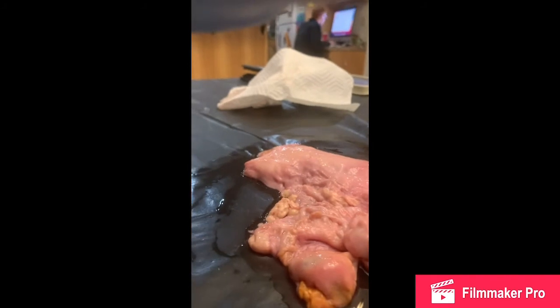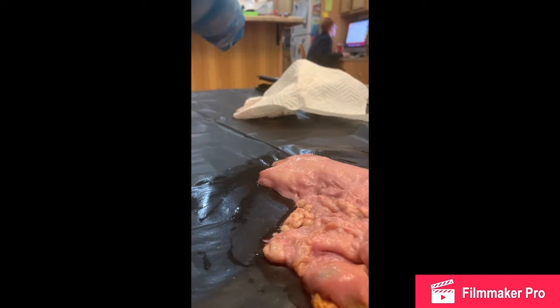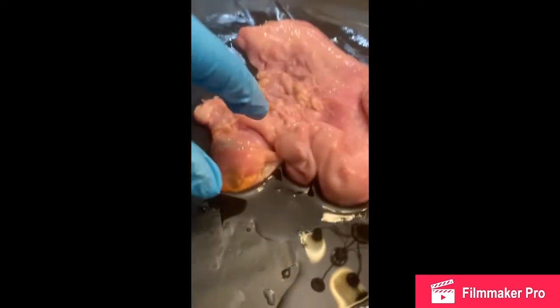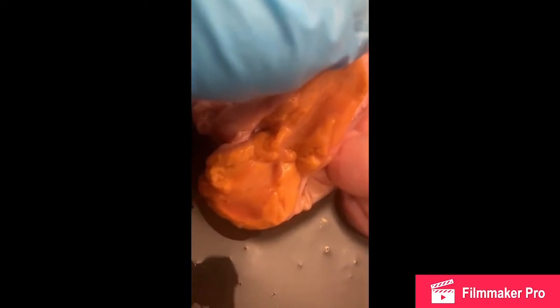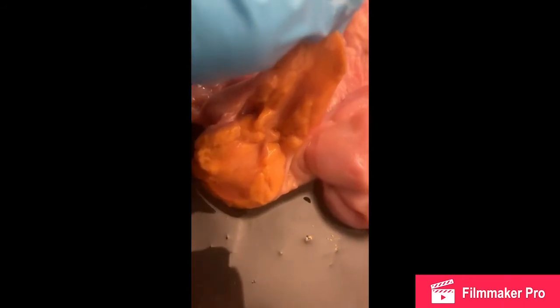In cutting open our ovary, we can see, so open this up. Our central portion, it's kind of hard to see here, but that is where our medulla is going to be, and we can see some blood vessels that go into our ovary here.